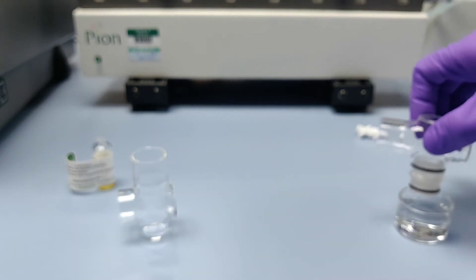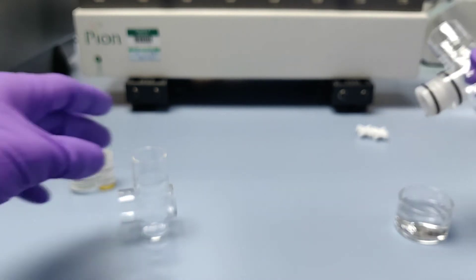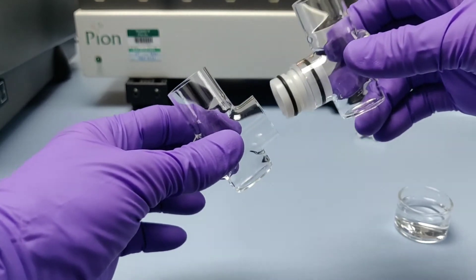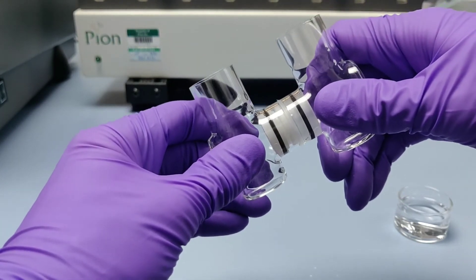After painting the membrane, the flux pairs must be filled with media within no more than 10 minutes to prevent the membrane from drying out. The second o-ring is wet with water, taking care to avoid contact with the membrane, and pressed into the second half of the pair.